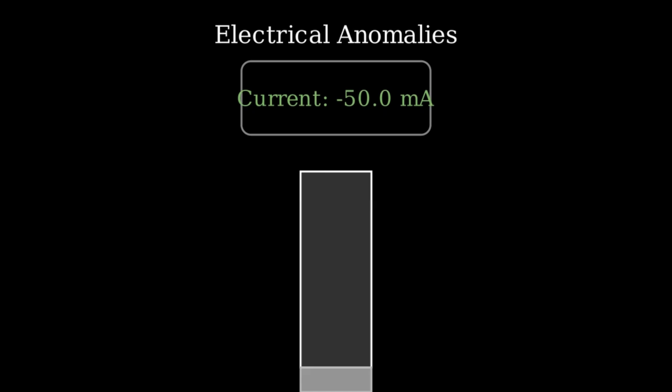If your system throws a compliance error, it means the machine is struggling to push electricity through the liquid. This usually happens if your ion exchange membrane is completely dry, or your electrolyte concentration is too low.